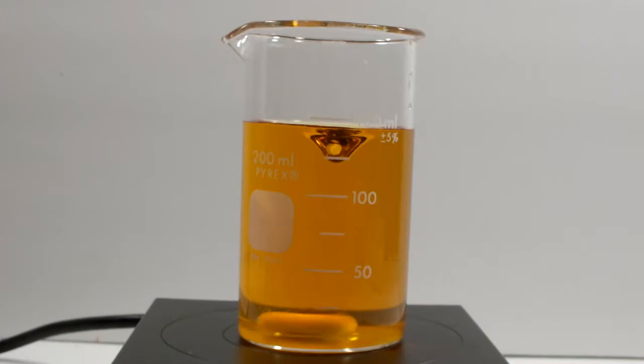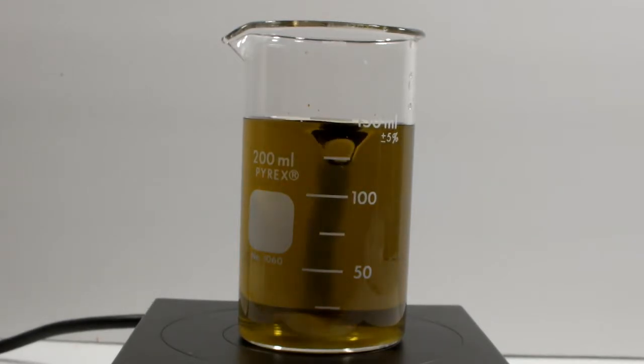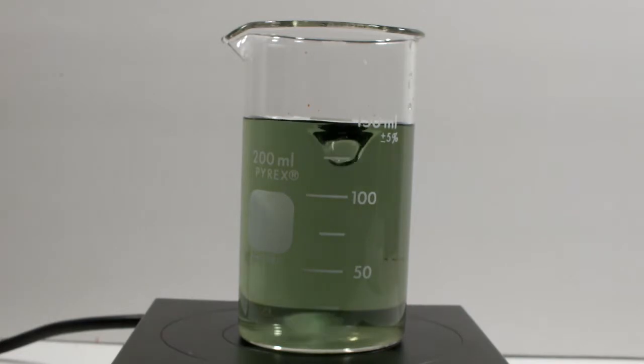Oh, by the way, only the malonic acid solution is new. Everything else is the same. So now we'll add the ferroin. I just love colored vortices. So we have the green to start. And if we just wait for the moment where it actually starts the reaction, we do get a transition to blue. So we're on the right track.